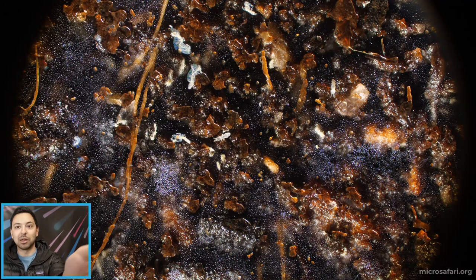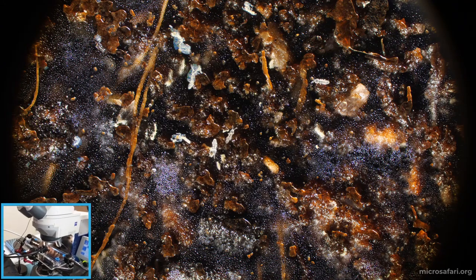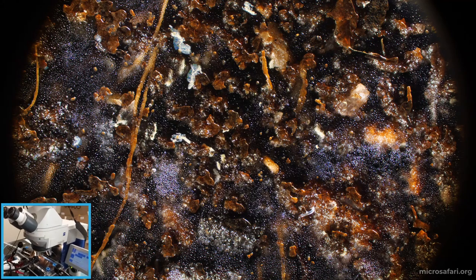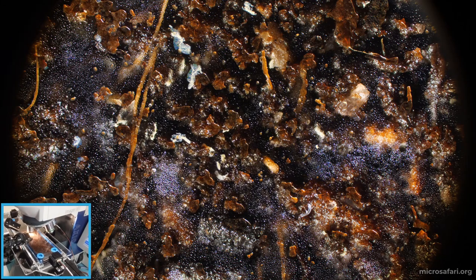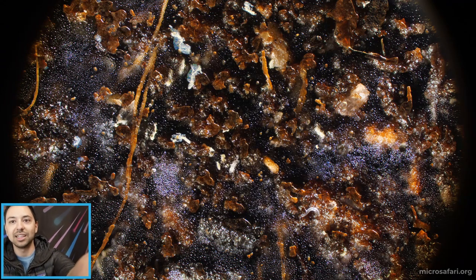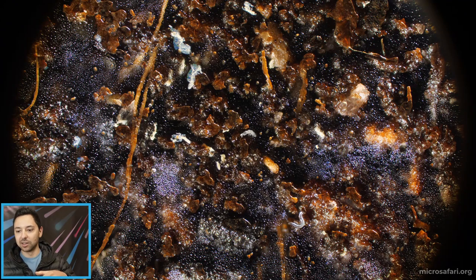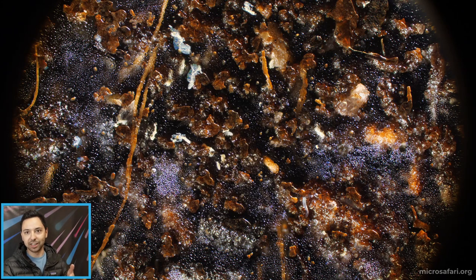Let me just show you my microscope setup real quick to give you a little insight into what's going on here. I have this really fancy looking microscope that I got from medical surplus for real cheap, and I've rigged it up to record one of these little safari slides. The lights are shining on it because you need that for a microscope to operate properly, but one of the issues is that the lights will cause the water to condense on the inside surface of this thing, and it forms these tiny little droplets that reflect the light and make it look like there's a white fog everywhere.